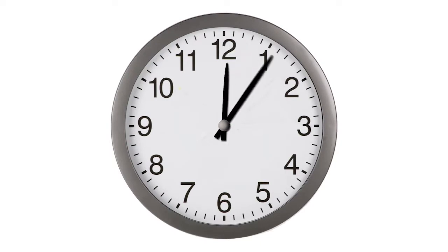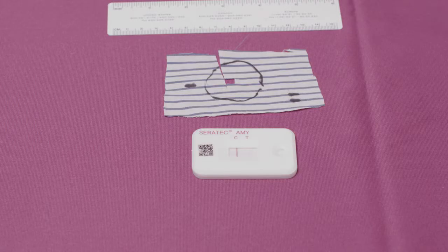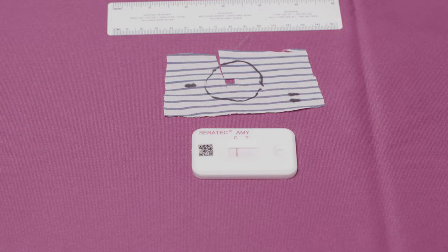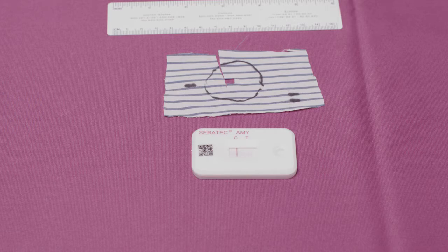Read the results within 10 minutes. Allow the membrane to incubate the full 10 minutes to call a negative result. Photograph results. Positive membranes may be retained to demonstrate results.